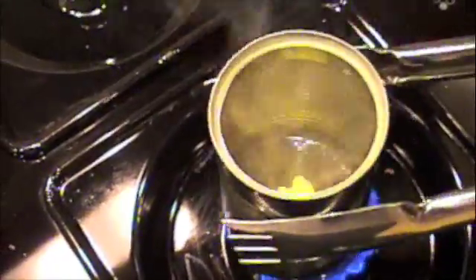As the chains continue forming from the rings, they're getting tangled together, and it's just getting thicker and thicker and thicker. It's a really thick liquid now because the chains are getting tangled together.